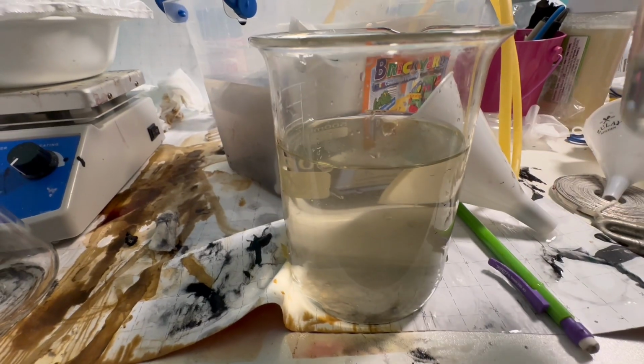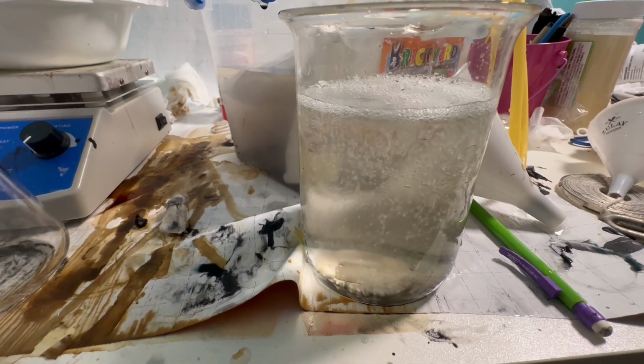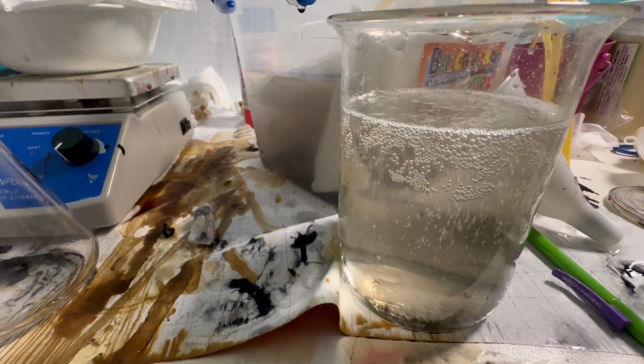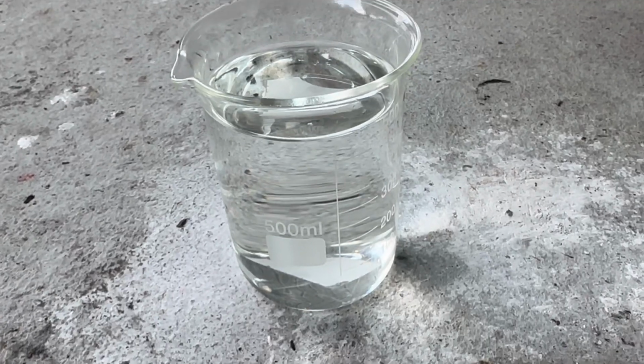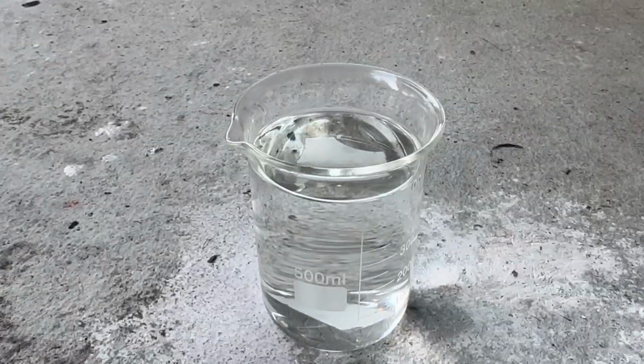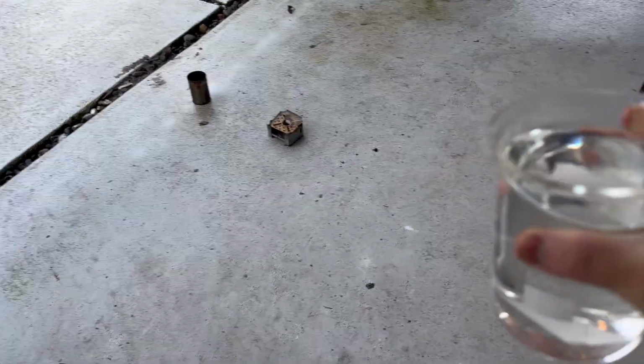I added a bunch of hydrochloric acid to the solution so the phthalic acid could precipitate out. However, not only was there no precipitate, I also couldn't boil the solution down because it was releasing acid fumes everywhere. Nothing happened even when I took it outside overnight. So of course, this experiment was a failure, and I just wasted half of my day on nothing.